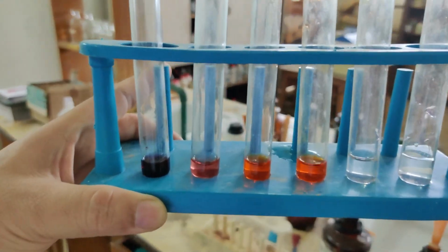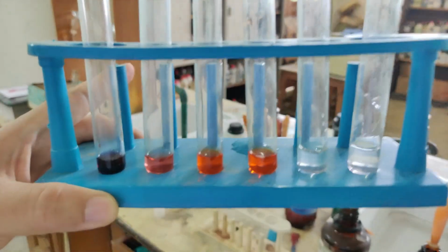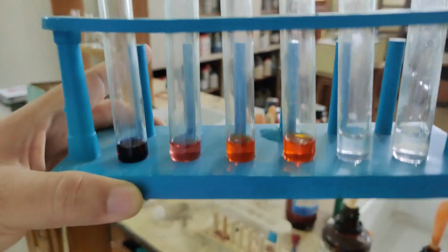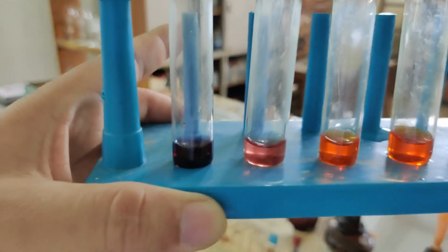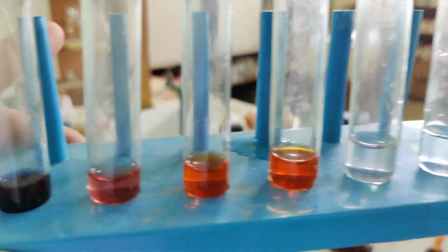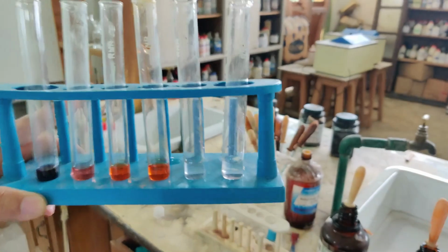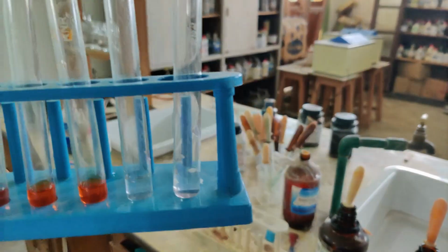One is an acid, the other one is a base, and one is dilute hydrochloric acid. You can use any acid you like, but I would prefer to use dilute hydrochloric acid, and the other one I am going to use is ammonium hydroxide. So let us see what color change. Now see again for the last time what the colors look like. See blue litmus, red litmus, methyl orange, both of these are methyl orange, and both of these are phenolphthalein.